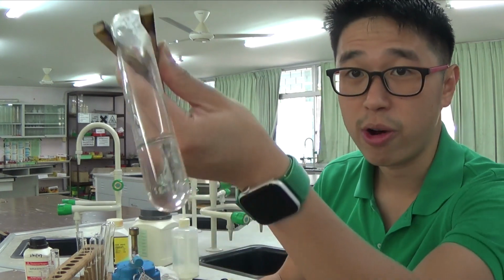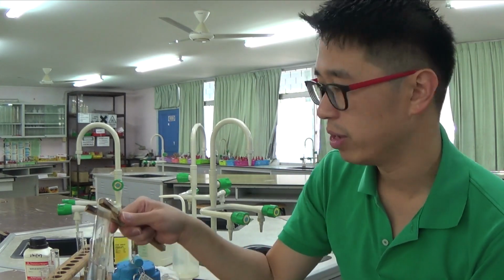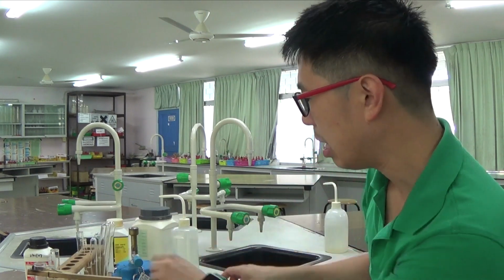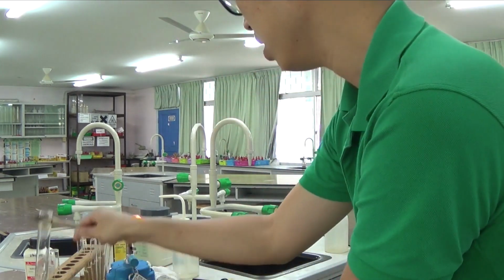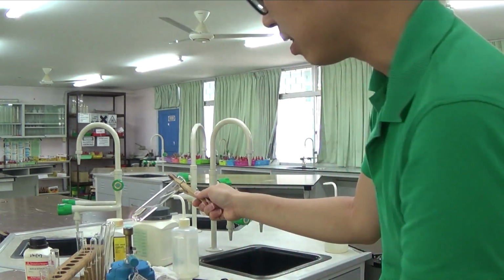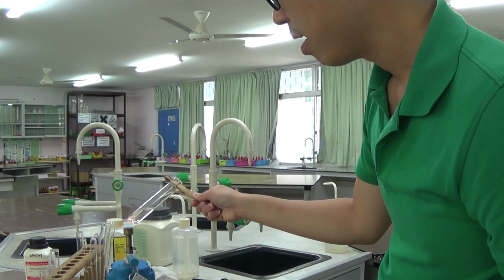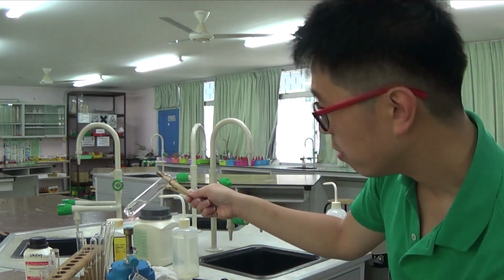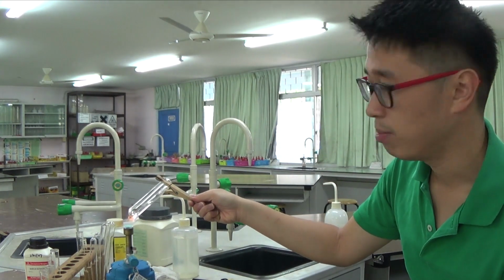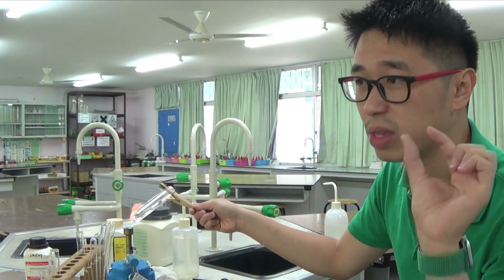that before I add the aluminium foil to it, all the ammonia from the ammonium ions has already been converted to ammonia. So I need to heat it very strongly until all the ammonia has gone. And of course, you can test for when all the ammonia is gone, because when there's no more gas being given off, you can test with the red litmus paper and it will not turn blue, because there's simply no more ammonia from the ammonium ion.